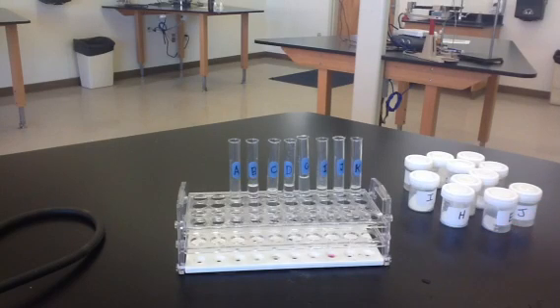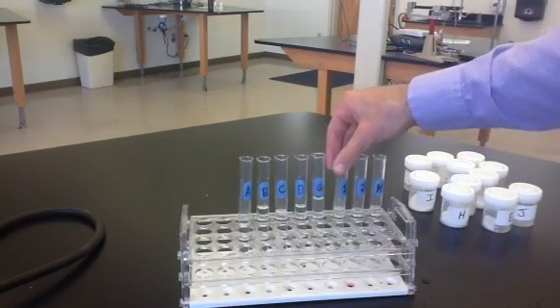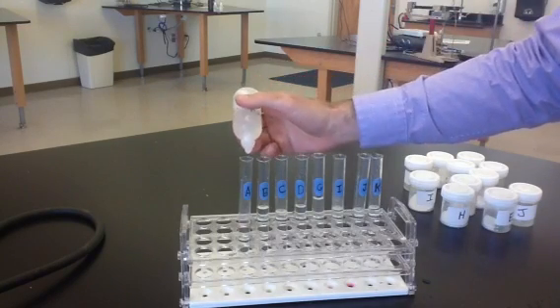So now we have the 8 substances that did dissolve in water. We'll do further tests on these. So these substances, the next test we're going to perform is adding phenolphthalein. So phenolphthalein is an indicator, and it will tell us whether these solutions are acidic or basic. So I'm going to try to just add a little bit of phenolphthalein to each one.